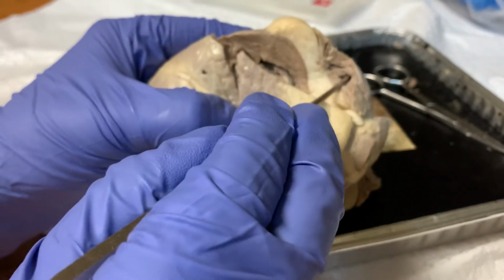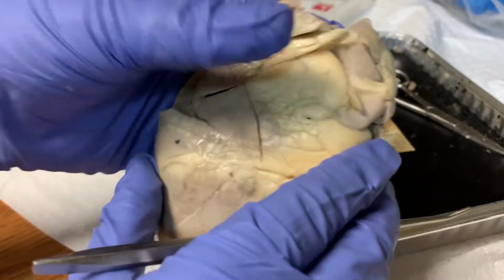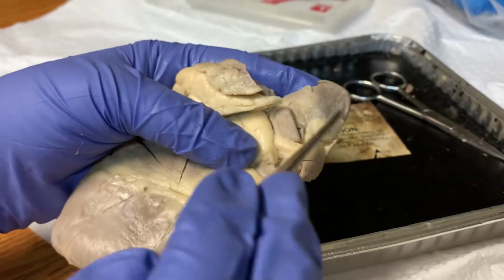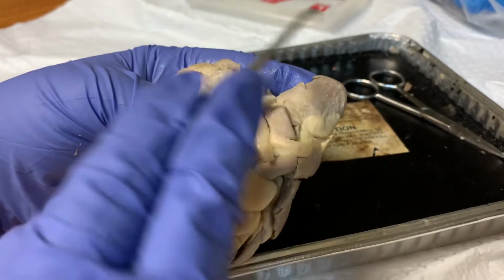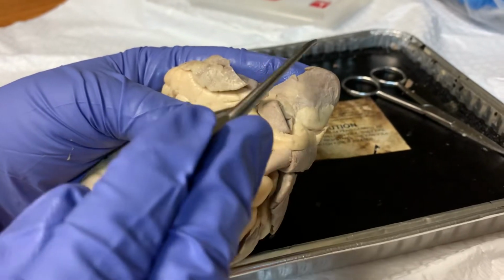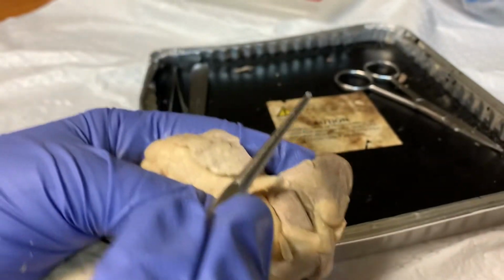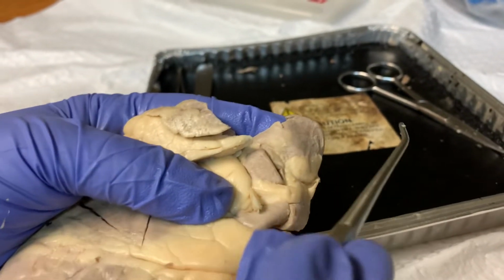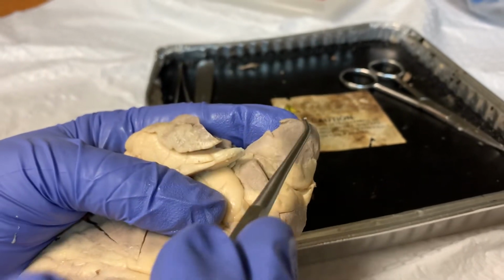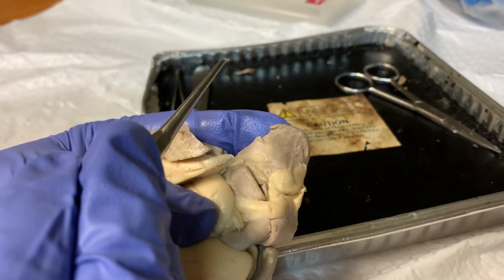So we've already briefly discussed the aorta, but it leaves the left ventricle carrying oxygenated blood to the rest of the body. The aorta divides into the left and right branches. And since the majority of the heart is located on the left side of the body, the right branch actually has to travel further than the left to supply its assigned structures. The brachiocephalic trunk is the structure that allows blood to travel the extra distance from the left to the right side of the body.